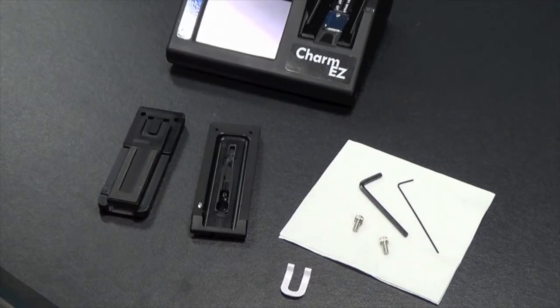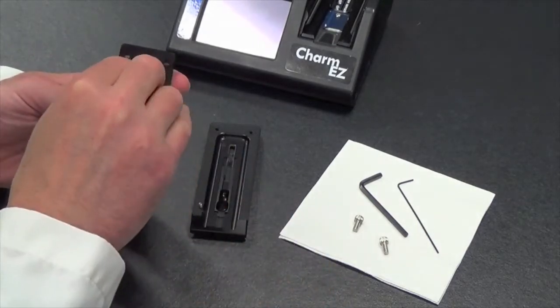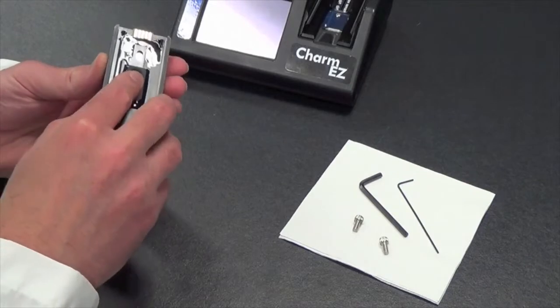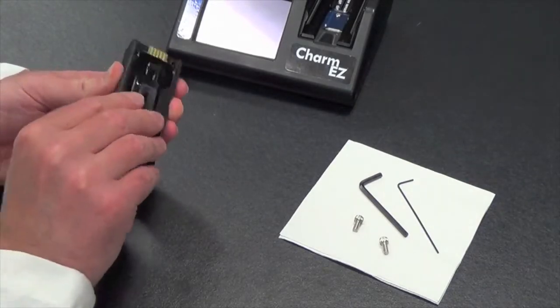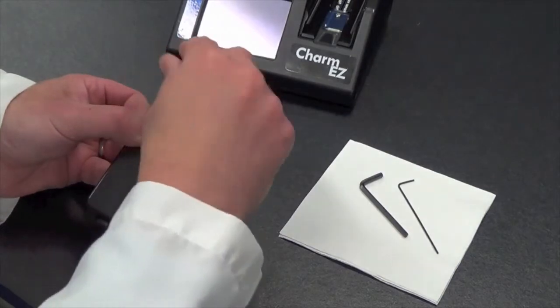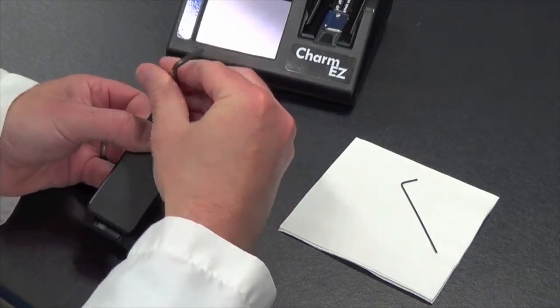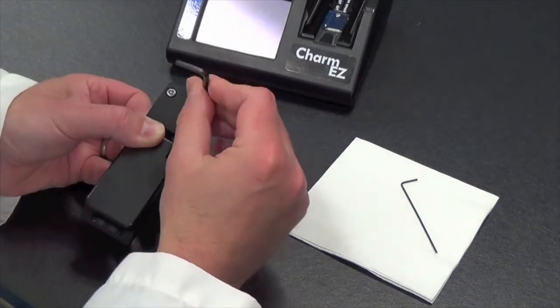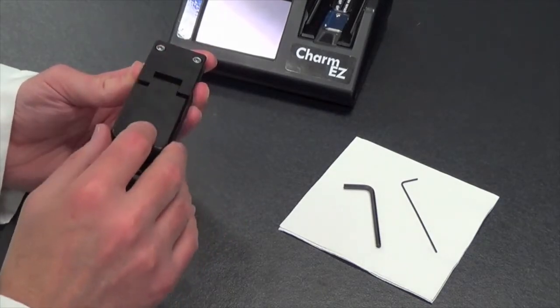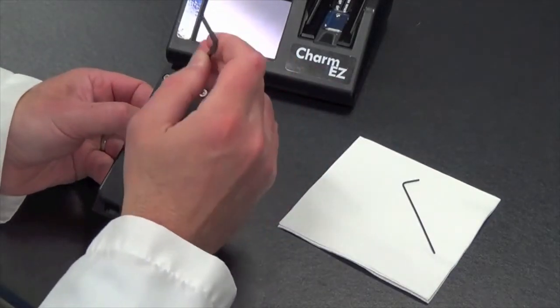So to reassemble the Easy Slide, what we will do is take the top half or the hinged portion of the slide assembly, take the white horseshoe, place that into the opening, and the easiest thing to do is place the bottom slide upside down on top of the top hinged piece. Flip this over, and then you can take the 2 screws that we removed and screw those back into place. Do not tighten them completely. So what we want to do is make sure that when we operate the hinge, so if we open and close the hinge, it's a nice smooth operation and it's not misaligned anyway. Once you have it aligned properly, tighten these top 2 screws.